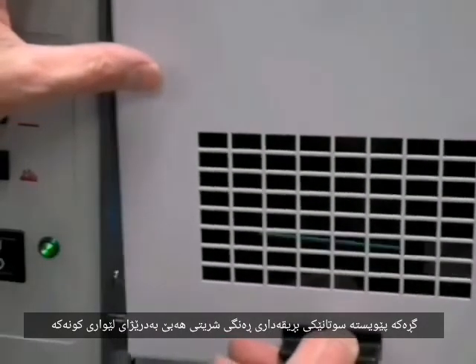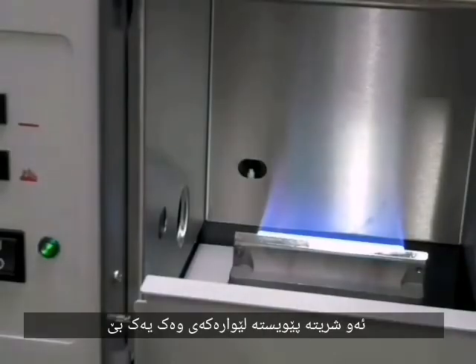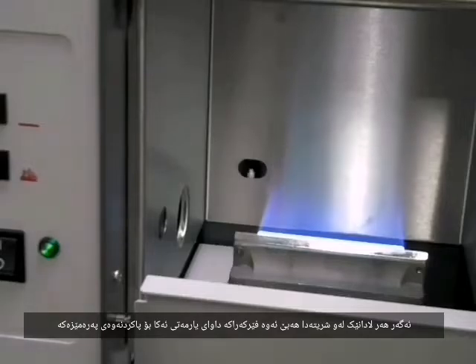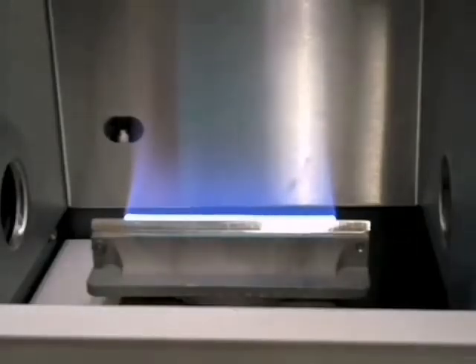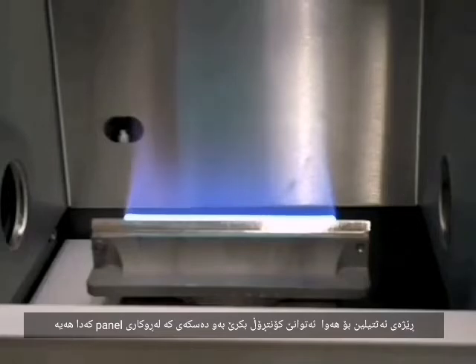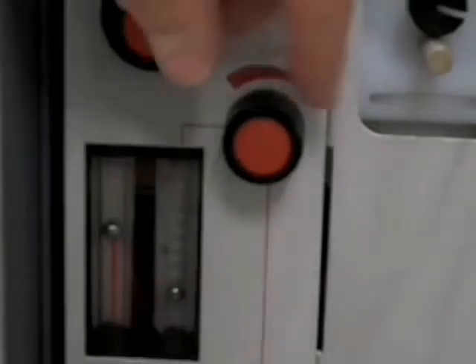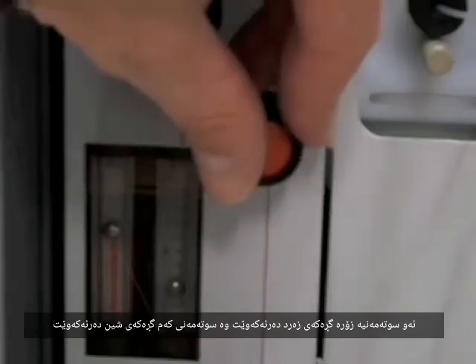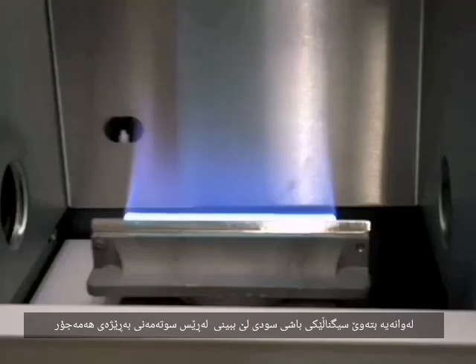The flame should burn with a bright ribbon of color along the edge of the slot. This ribbon should have a uniform straight edge to it. If there are any breaks in the ribbon, ask the instructor for help in cleaning the burner head. The ratio of the acetylene to air can be controlled with this knob on the front panel. A fuel-rich flame looks yellow. A fuel-lean flame burns with a faint blue color. You may want to optimize the signal by varying the fuel ratio.